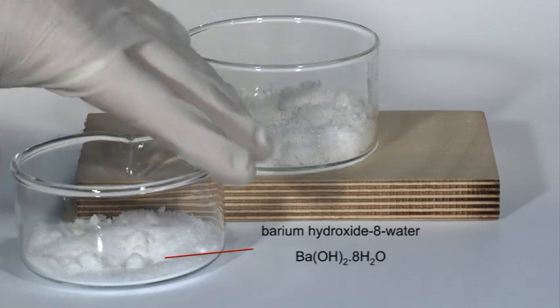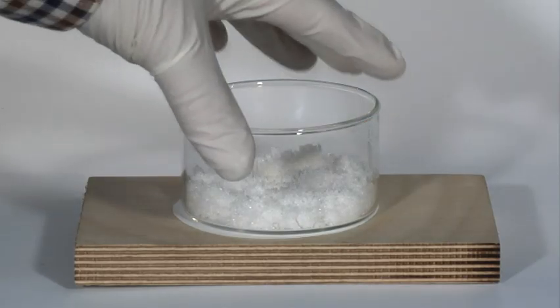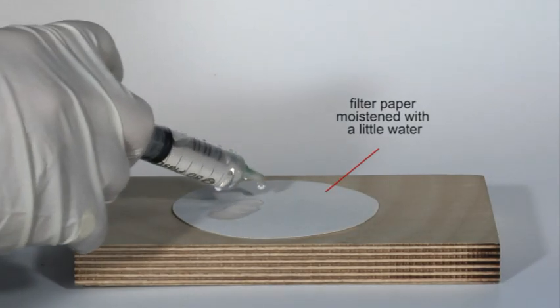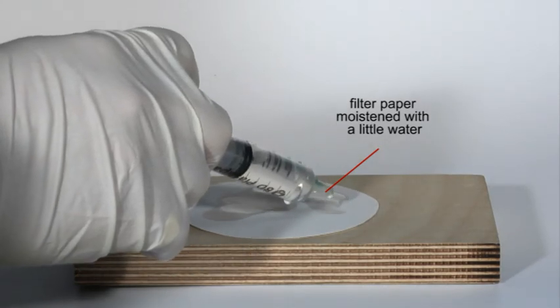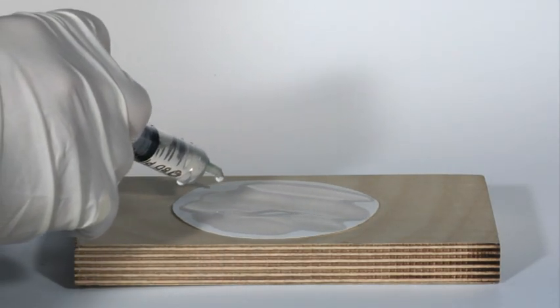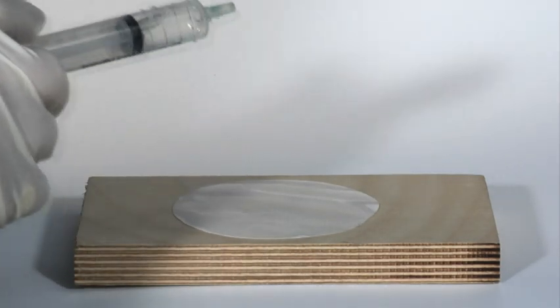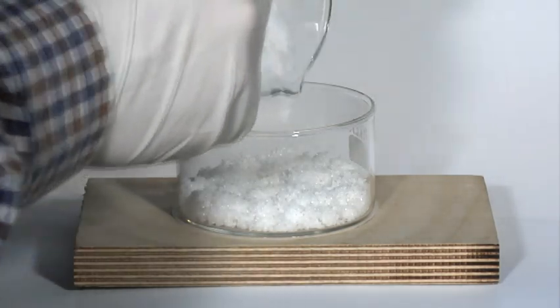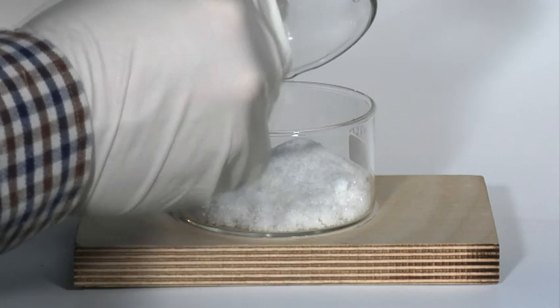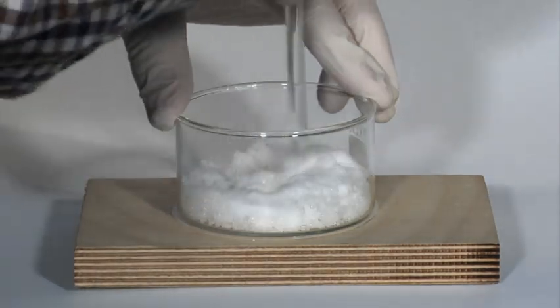This popular demonstration illustrates an endothermic reaction which produces a large drop in temperature. The solids are thoroughly mixed in this crystallizing dish which is held firmly over the wet filter paper.